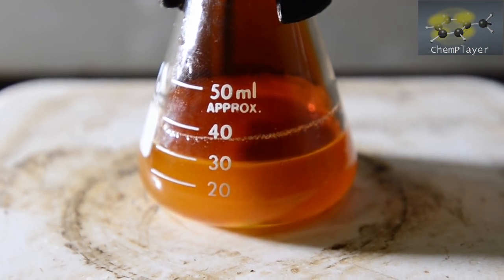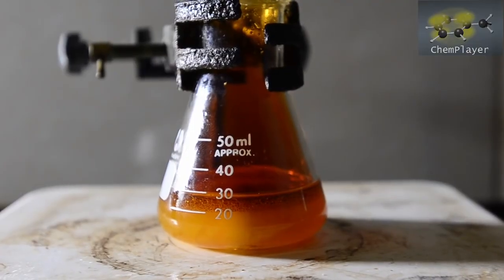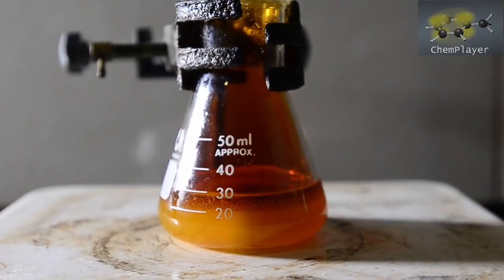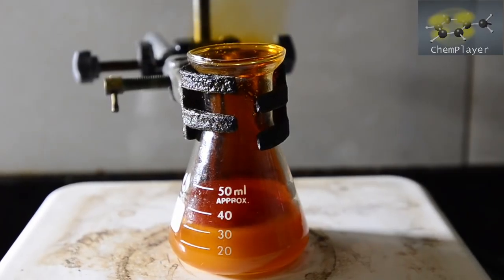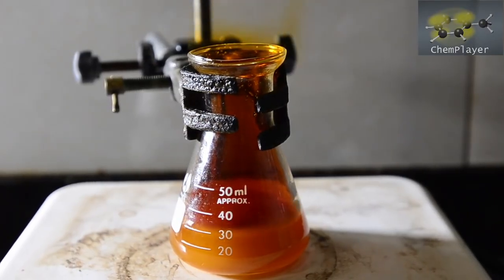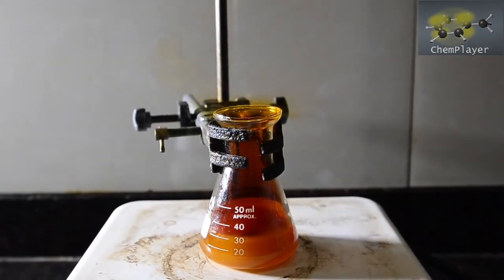Towards the end of this time, if we stop stirring, you can see that most of the solid is gone and the mixture actually consists of 2 layers. Continue to the 15-minute point and then raise the flask up from the hot plate and allow to cool slightly for a few minutes.